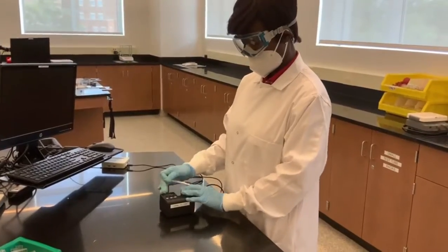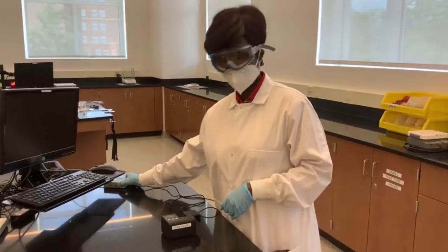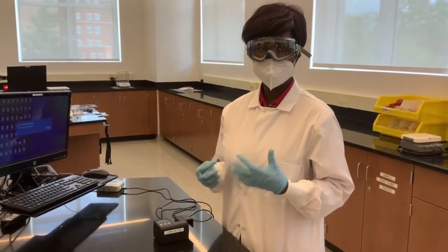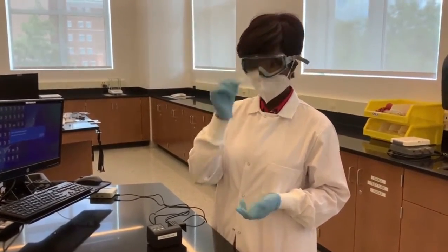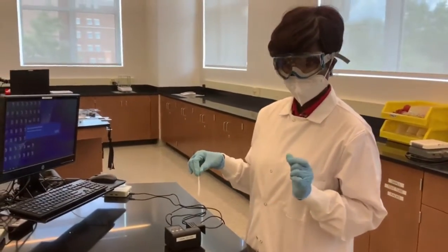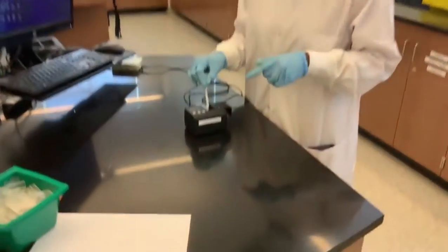So for part B of this lab, we'll be using a colorimeter connected to a Vernier to determine the color the wavelength of light corresponds to. So what we're going to do is use a plain sheet of white paper, and we're going to place it in this colorimeter and set the wavelength to a specific wavelength. So first, close it up.